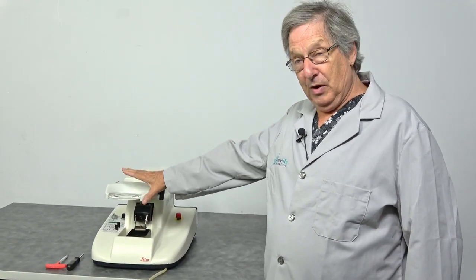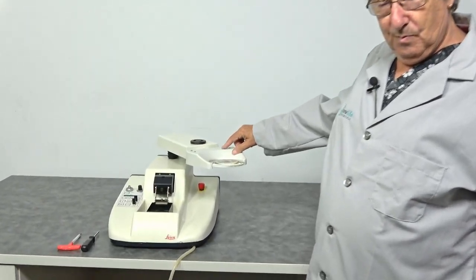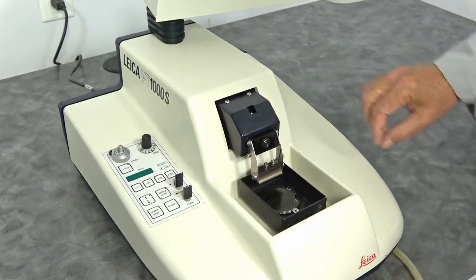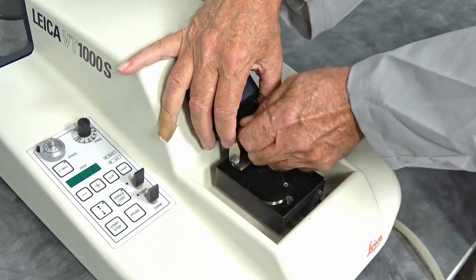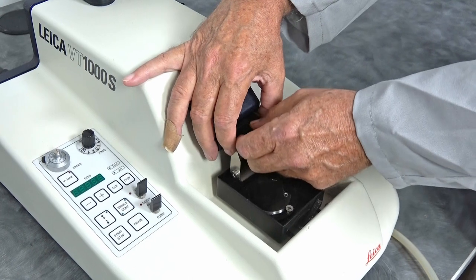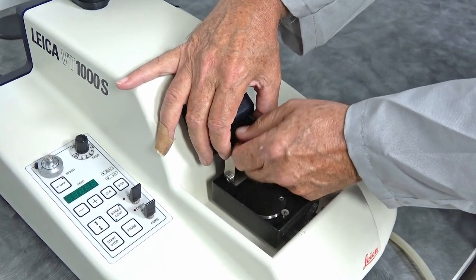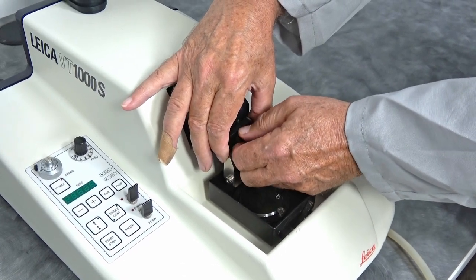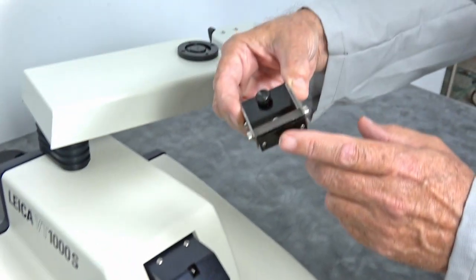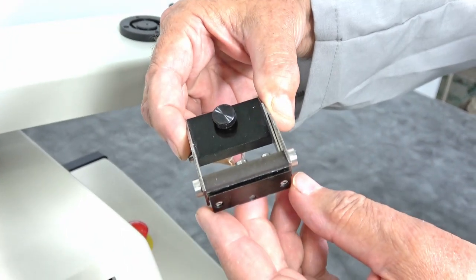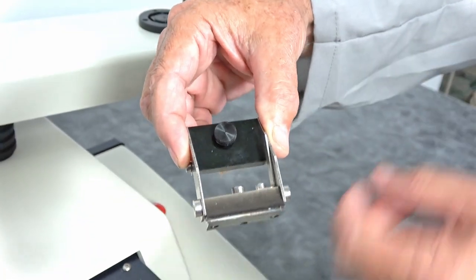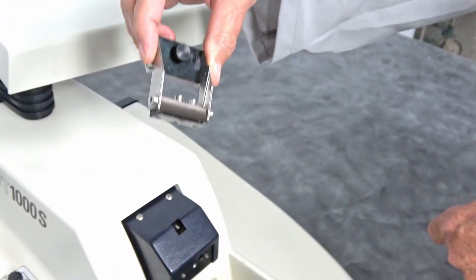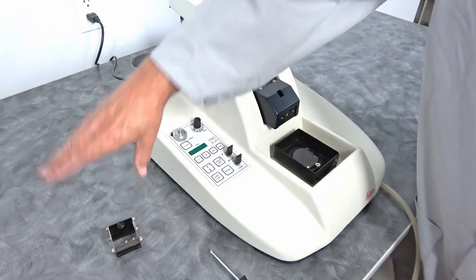Most of them come with the magnifying glass, a lot of them aren't coming with the trapeze to hold the knife blade. Once it's unscrewed, you can easily mount your blade in there. That Allen key will tighten that up into place. These are often not in the system when you get them.